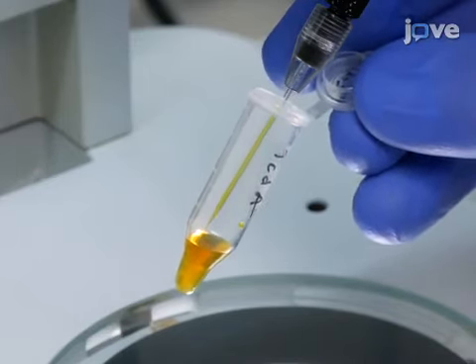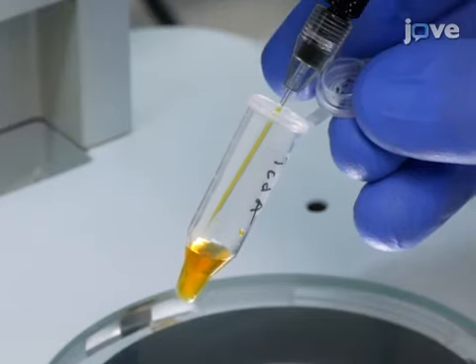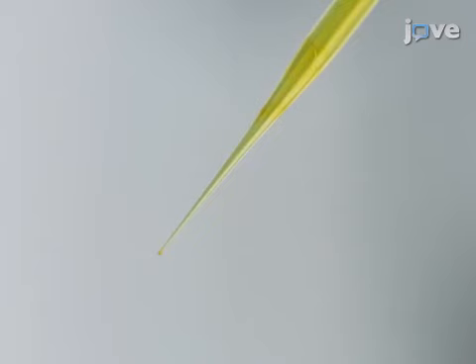When the microinjection suspension fills 90% of the length of the glass microcapillary, stop filling the microcapillary. Depress the syringe slightly before withdrawing the microcapillary from the microinjection solution to ensure that the tip of the microcapillary does not contain pockets of air.